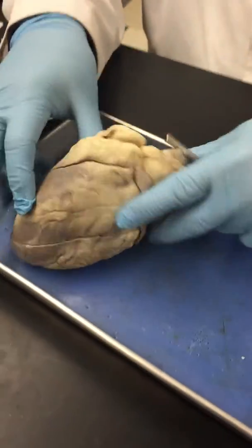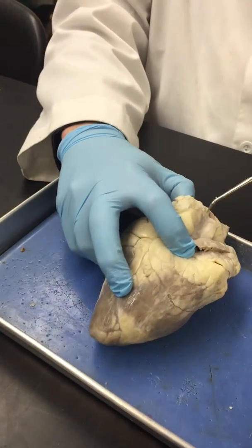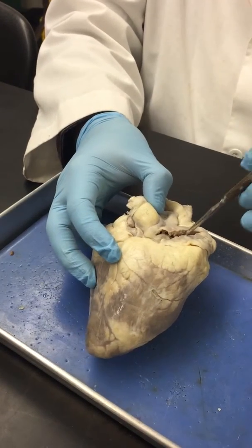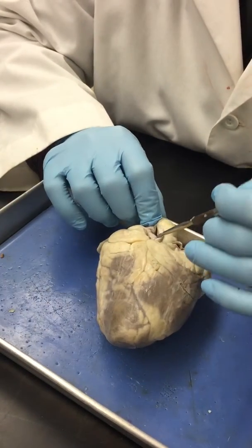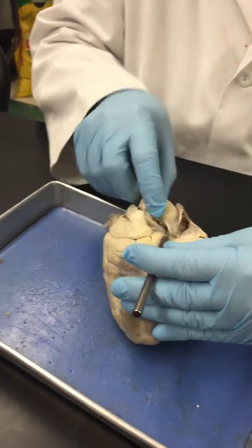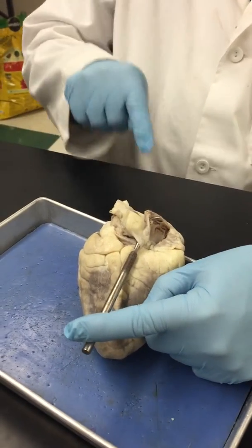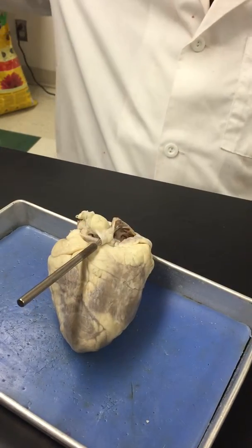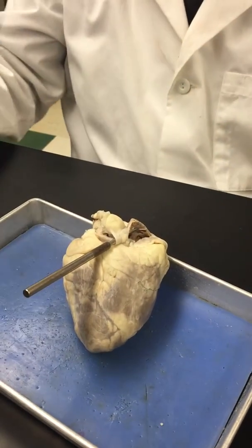Okay, the inferior vena cava. Now I have to go again. This is the ventral surface of the heart. I go to the dorsal. Recall that this is the superior vena cava. Well, the inferior vena cava also brings blood back to the right atrium, and that's bringing blood from your lower extremities. To find that, I just look for that cutoff vein. So now my probe represents the inferior vena cava. And see the tip of the probe, it's going into that atrium. So those two vena cava converge at the right atrium with unoxygenated blood because it's been used up by your systemic circuit.